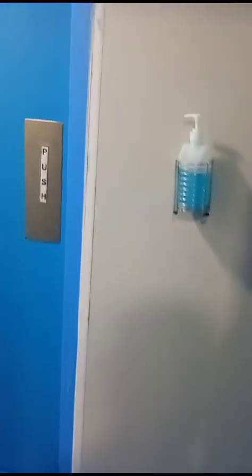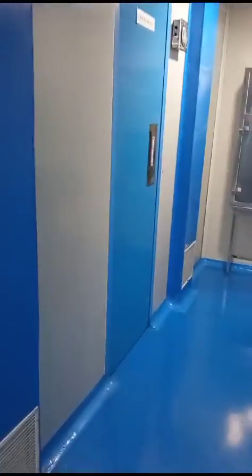This is airlock room 1. I have a filter. After that we move to airlock room 2. Then we enter the 4-foot corridor. Here we have 4 sections.